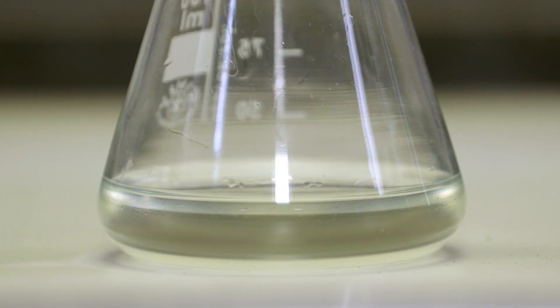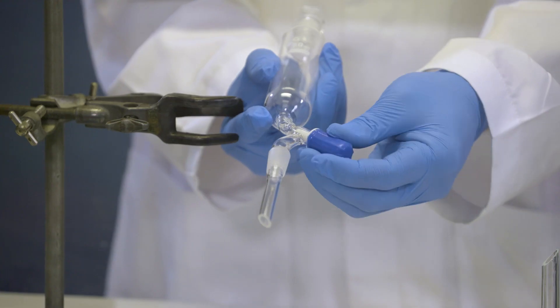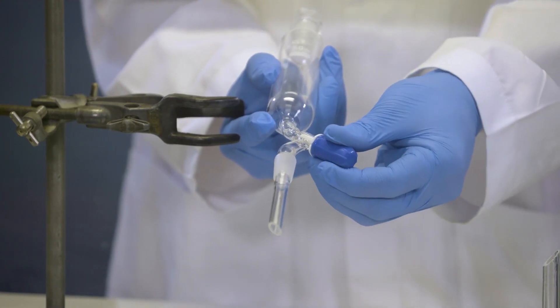As you can see, two layers have formed. We're now going to use a separating funnel to separate out our product. Little tip, make sure the tap is closed before you pour in the mixture.